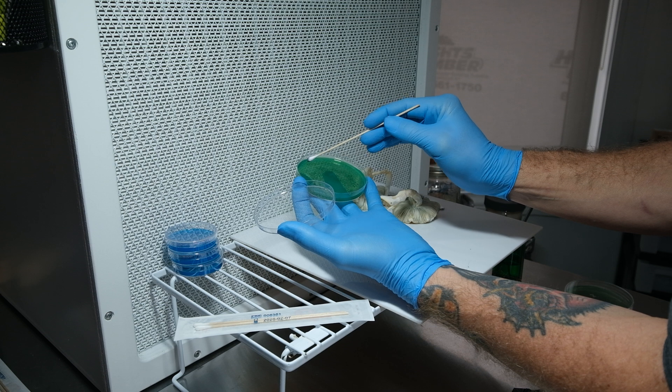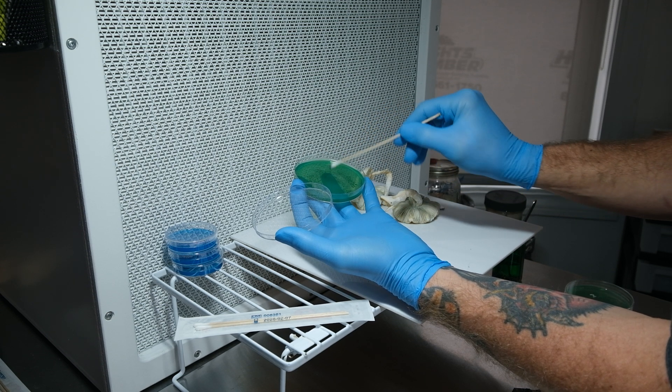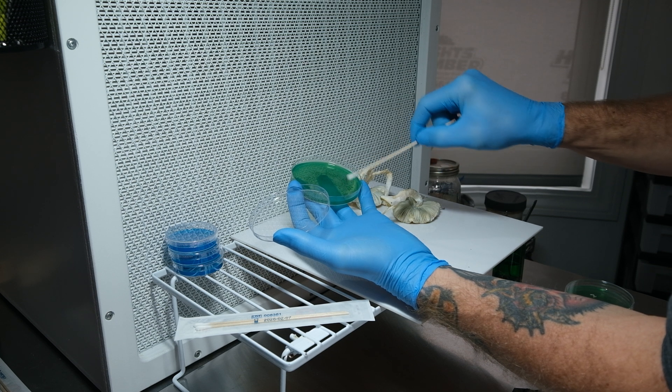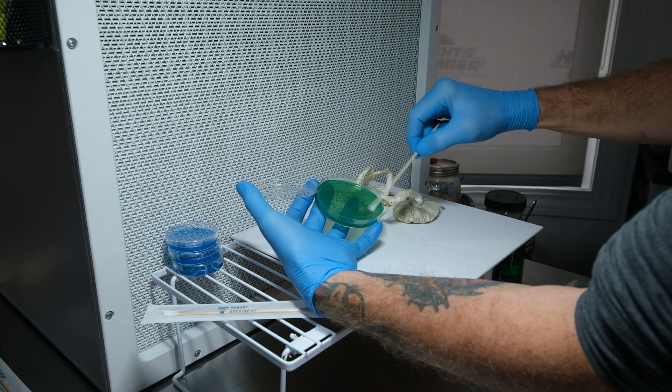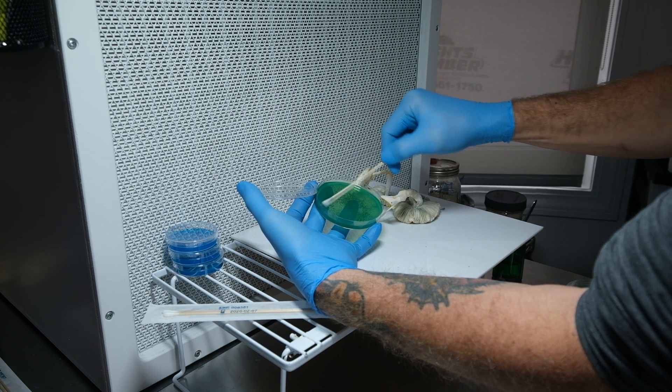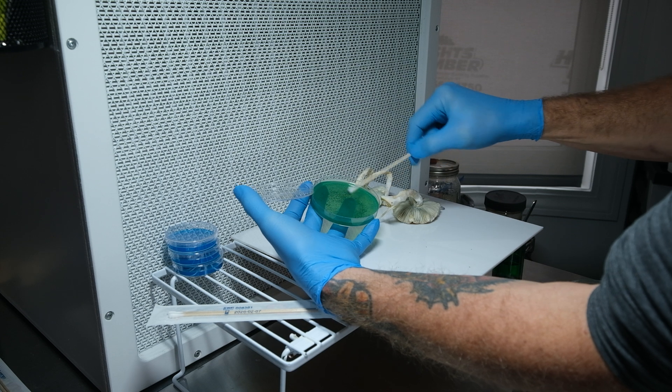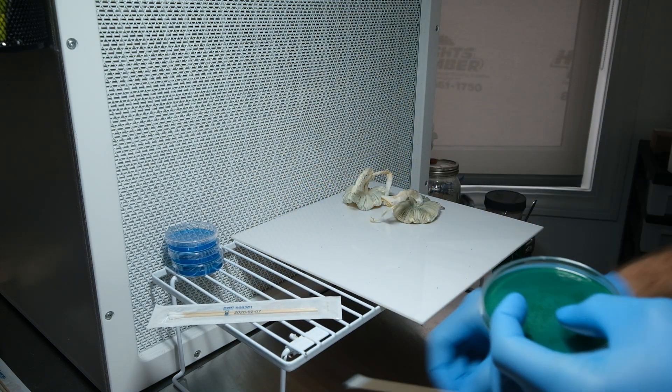So what we're gonna do here now is we're gonna take this plate and we are just gonna hold it back here and we're gonna streak this whole thing. All right, I'm gonna try and get as many spores on this plate as possible and then we're gonna turn it and then we're gonna do it again. All right, and then we're going to close it up and that's that. I'm gonna put this away now.